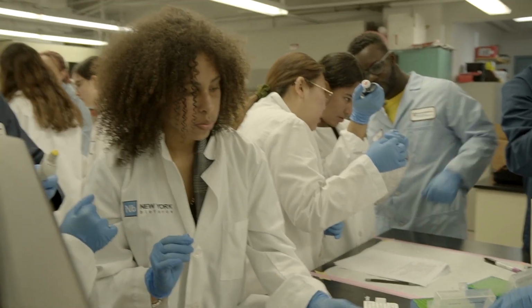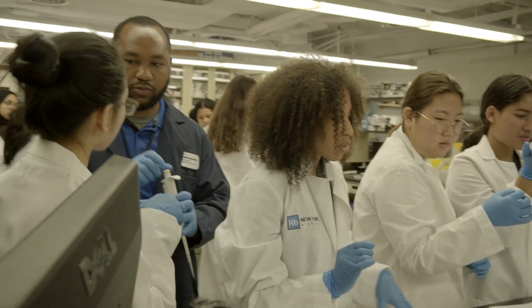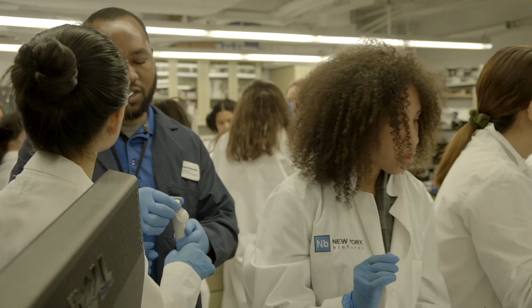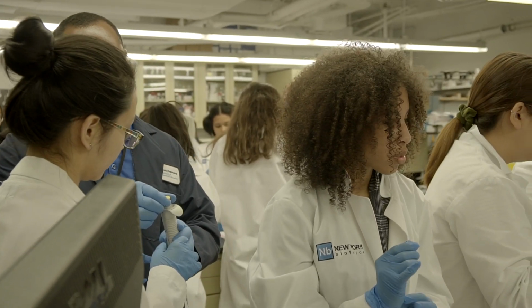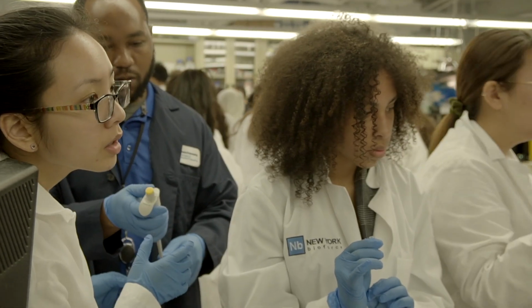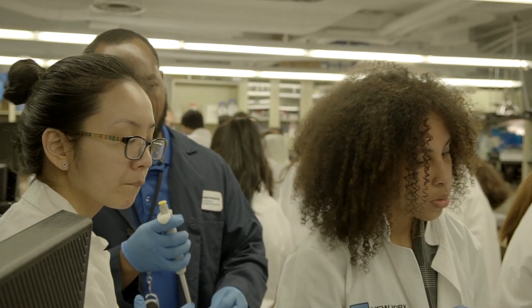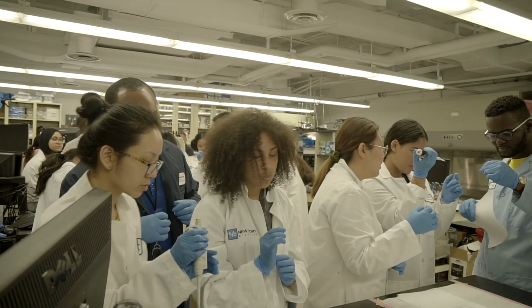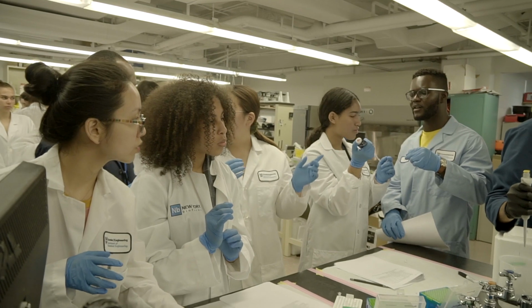So this is a P100. It doesn't go down to 2. Yeah, that's why it's starting to get stuck. This shouldn't go any lower than 10. So you need either a P20 or a... For small volumes, you want to put it into the liquid and dispense it in small amounts, or actually physically touch it to get the volume.